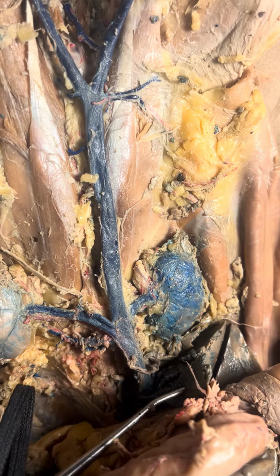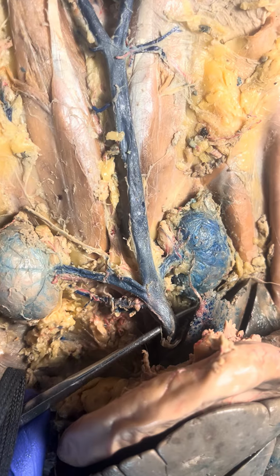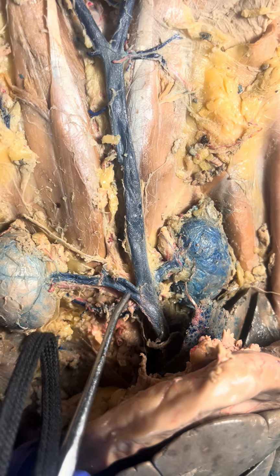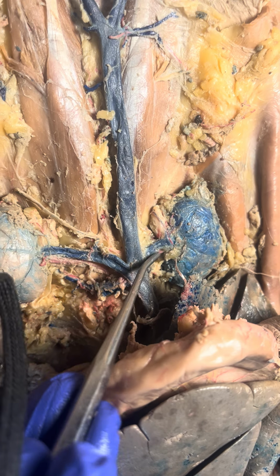Here's a piece of the liver. And cats have several hepatic veins that join together and then join the vena cava here, the inferior vena cava, but I can't see them. So I follow the inferior vena cava down, and I can see right away the renal veins. So here's one renal vein and the other one.